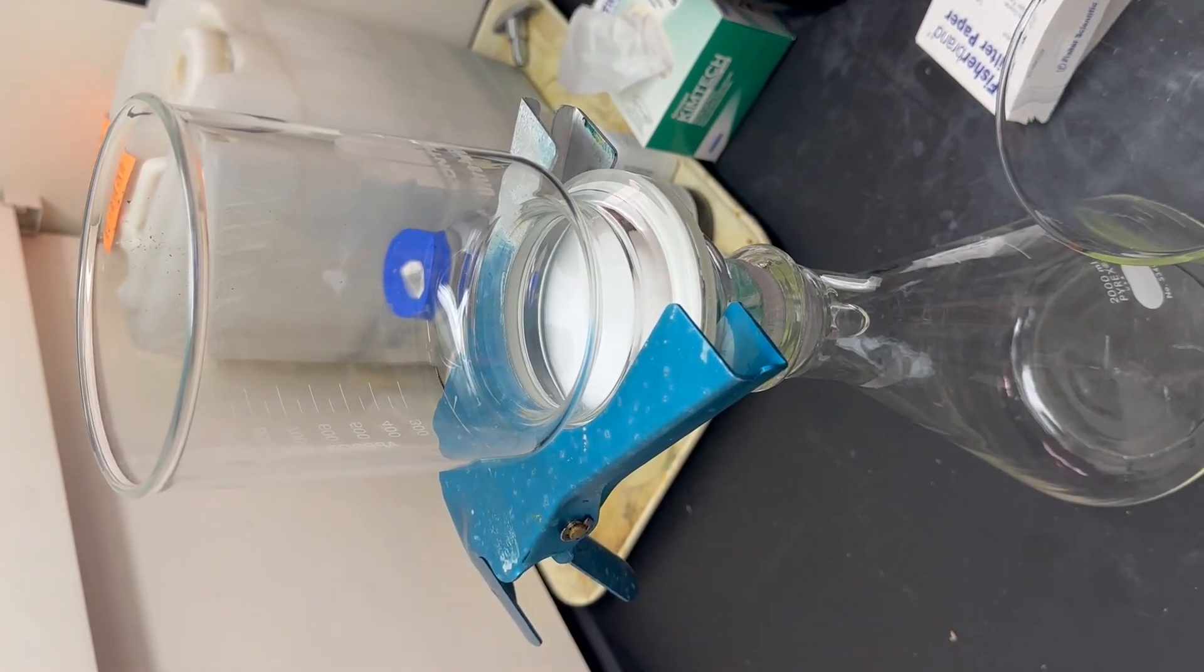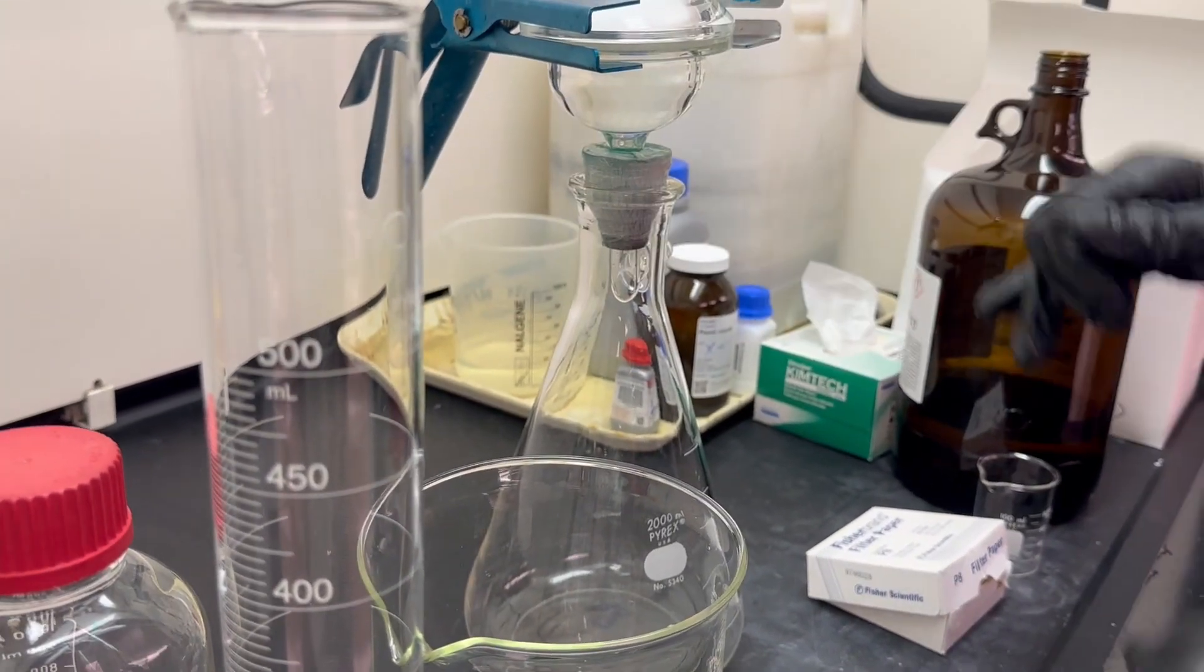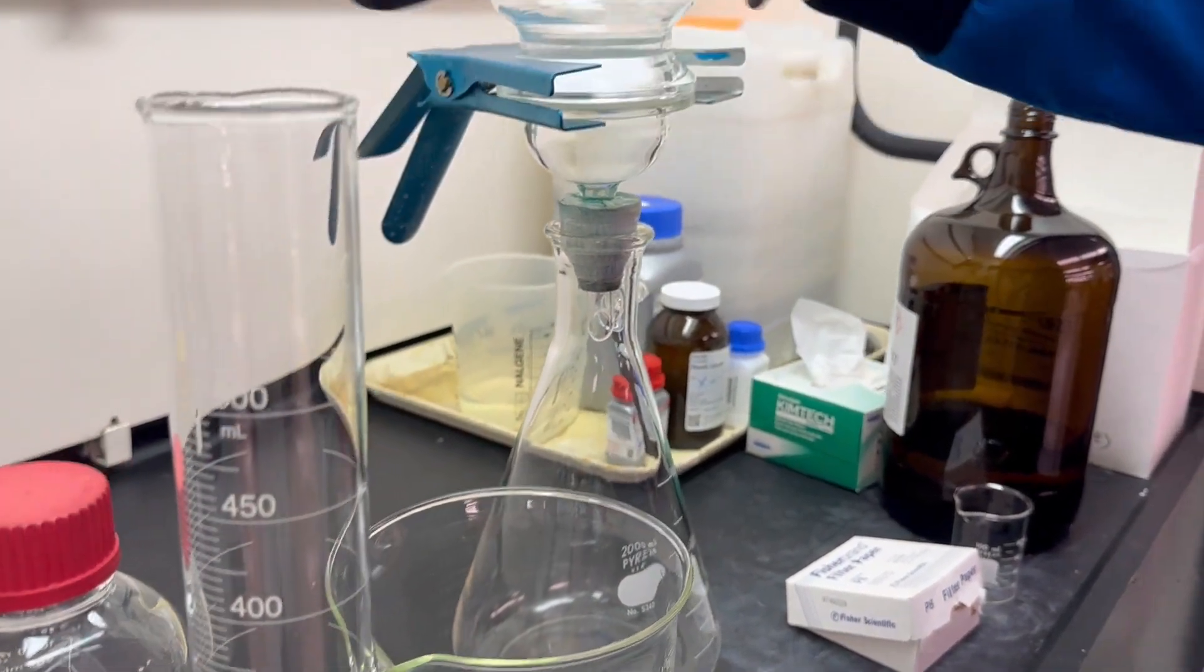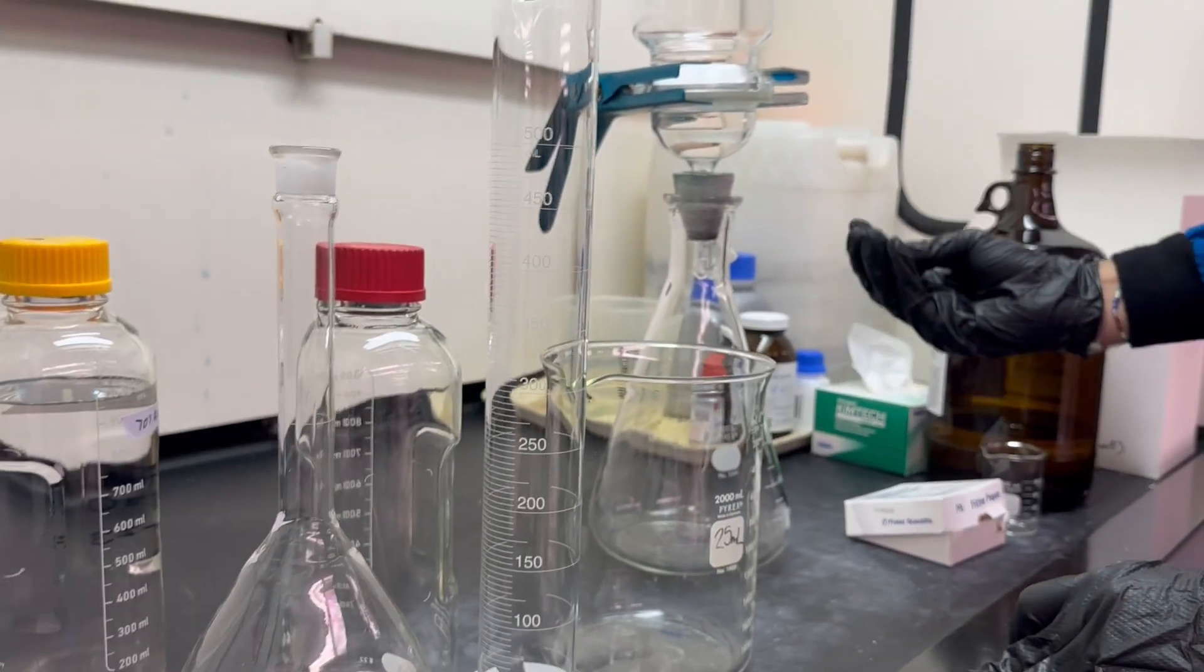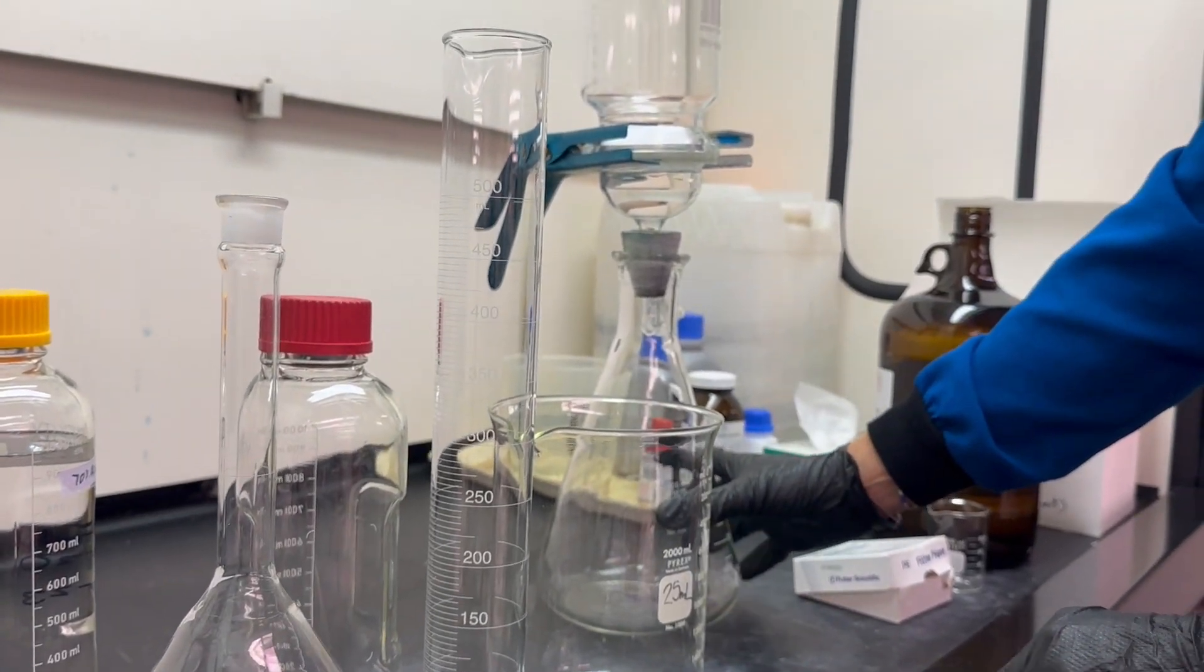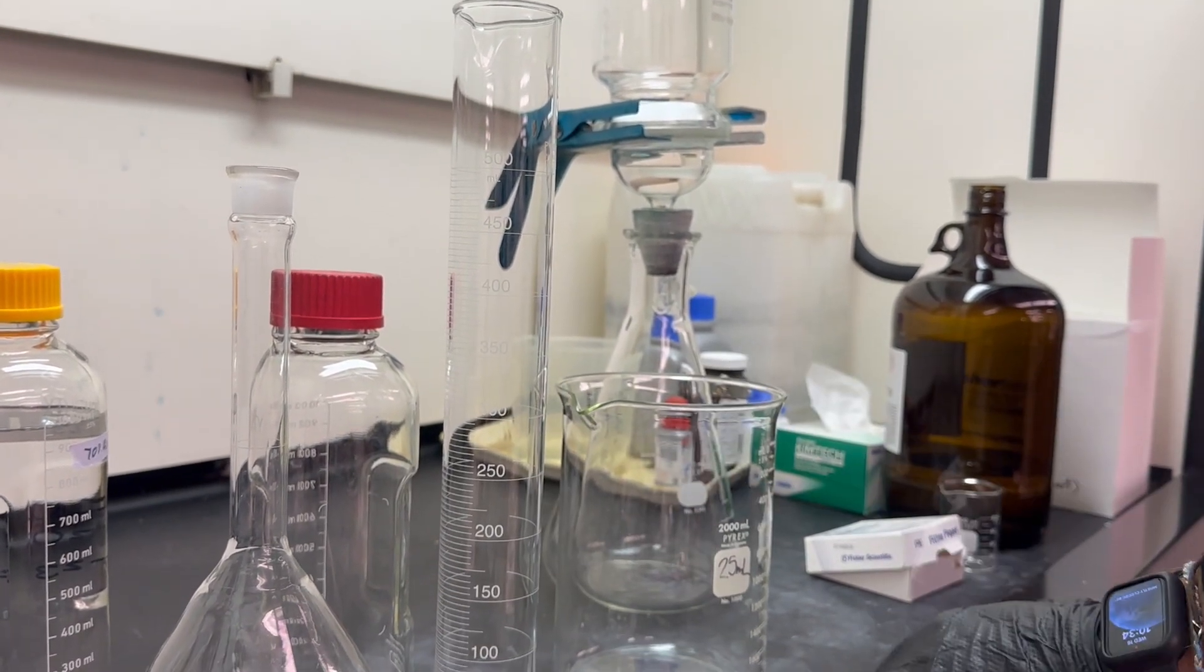Notice we need to wet this, but I don't have anything that I would like to combine in here yet, so I'm going to have to wait until I prep my 70-30 mixture. Then I will add a little bit of it, pull it through, and then discard that first wash. Let's go ahead and start first.